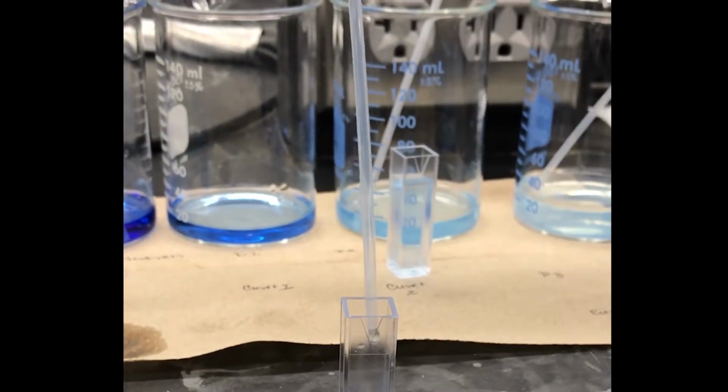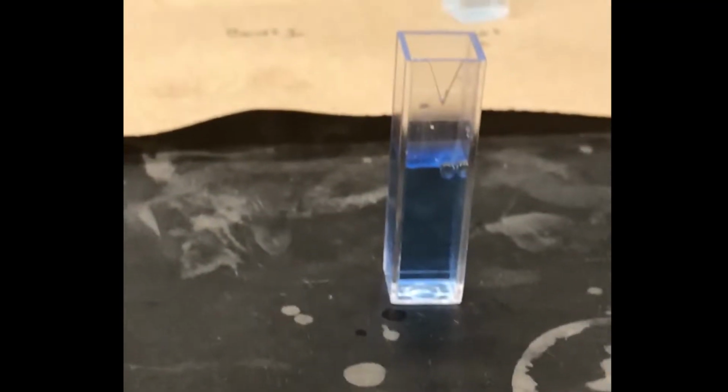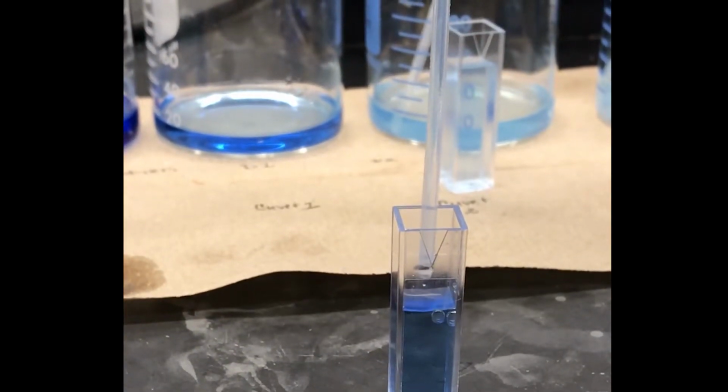Should I just get the thing, or I guess get me too? Oh yeah. So should I zoom in? Turn it the other way. Turn it that way. Perfect. Okay, now.